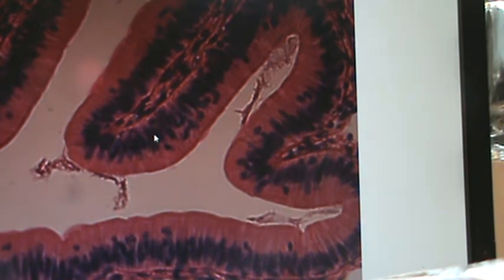Oh, there we go. This is a nice one here. Now, this debris out here actually is digestive waste, and this is the digestive tract. These cells, they go from there to there, and there's a single cell from that along these, with the nuclei staying dark. So what we have here is what's called simple columnar, because they're column-shaped cells, and there's only one row of them, right? And oftentimes in this kind of tissue, you can see the nucleus. They kind of all line up, and they're really in a line as we go through here. Okay, so this is simple columnar, and the major tissue type here is epithelial.